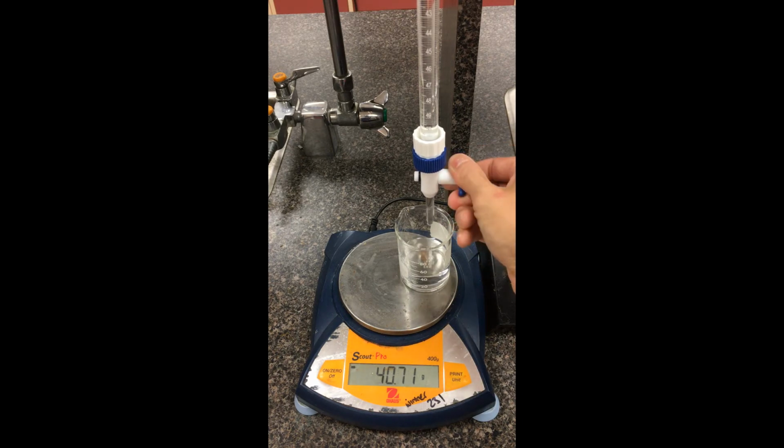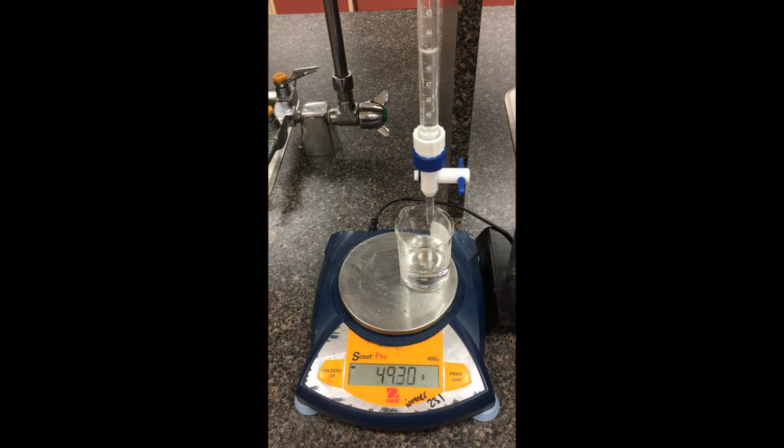Let's go down to 39.06. We'll record that down as a mass. Going down to 42. Okay, so 42.00 is the volume. You record this down as our mass. Go down to the 45. So 45.02 is the volume reading. Record that down for the mass. And one last reading here, heading down to the 48. We have 48.00 as your volume, and the mass is 52.56.